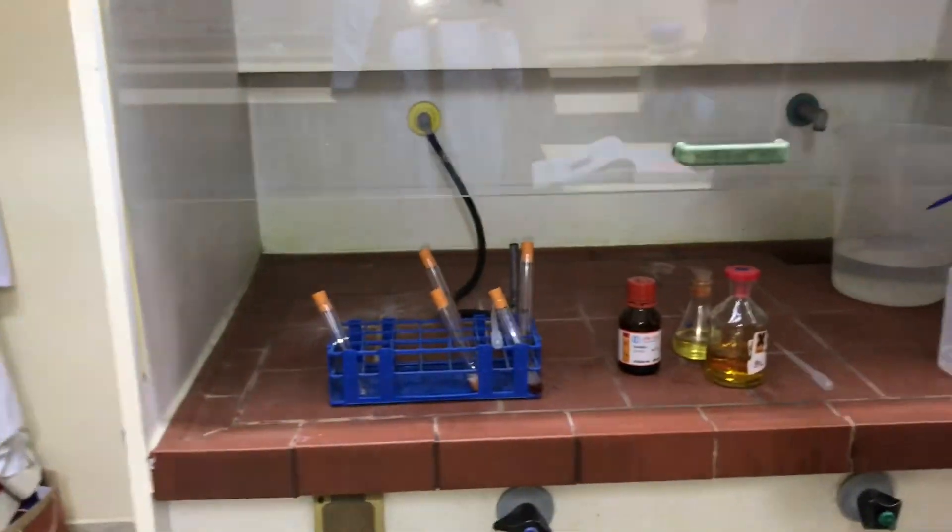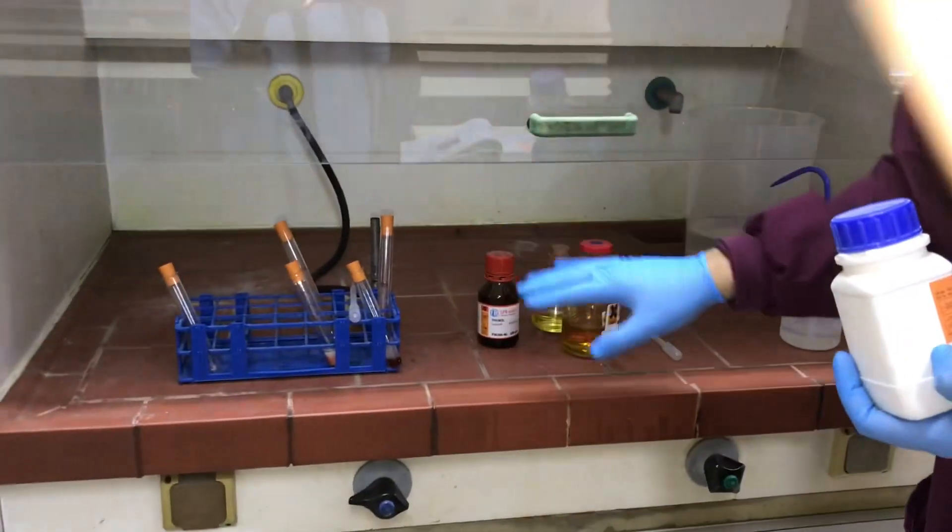I've got this fantastic fume cupboard over here, so all the air is being sucked through there and anything from the chemicals is being drawn away from me. This is also suspected to cause genetic defects, and it can cause really dramatic skin burns if in contact with the skin.